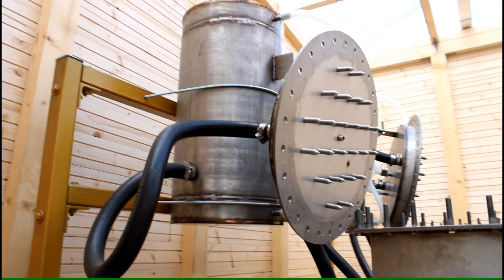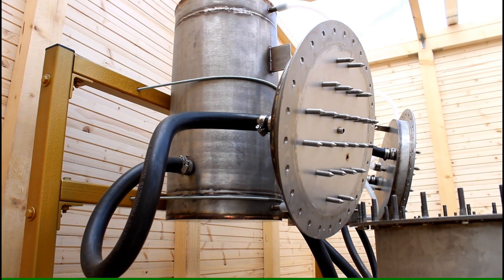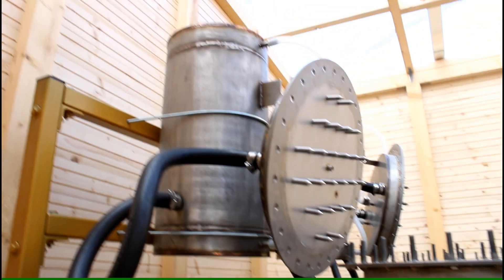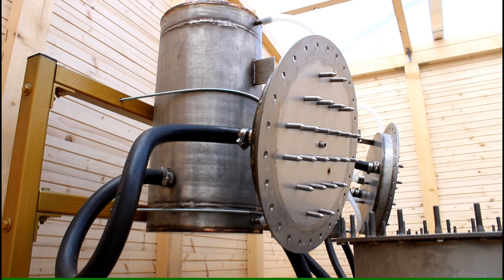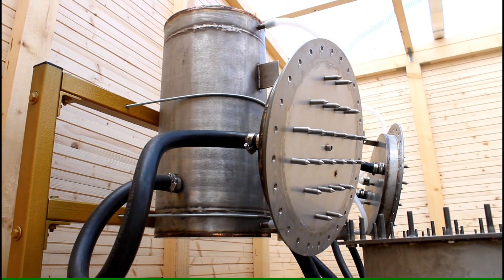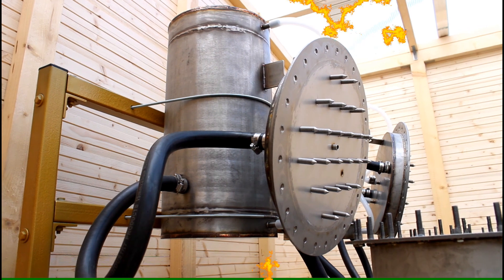So I have two main areas of condensation. It's first of all the lid and then whatever does not condense at the lid and drops down onto the herbs will condense in the top condenser here. My objective is today to make two kinds of tinctures.